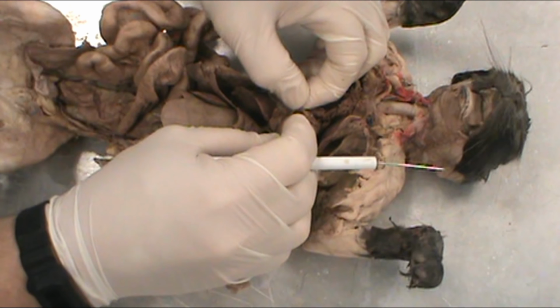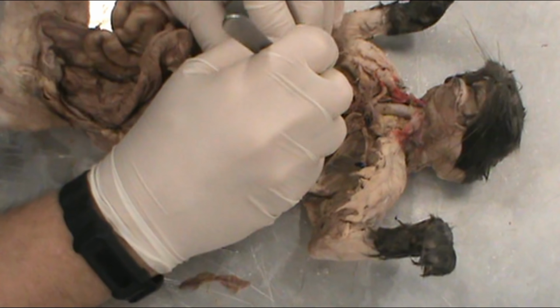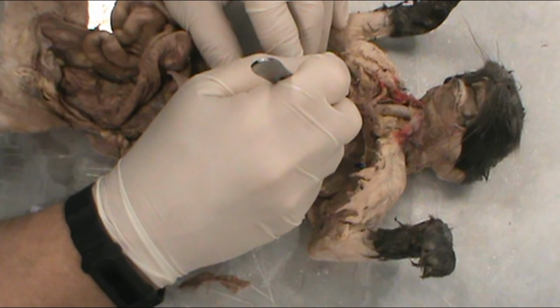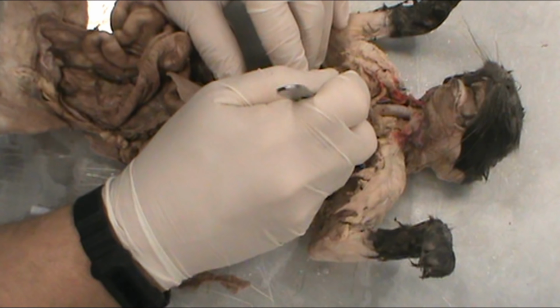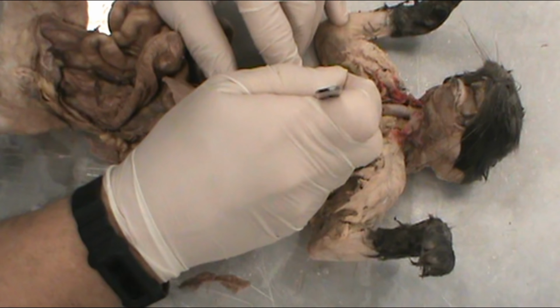And on this cat, we've removed the pericardium, which is this protective lining right here. Some of the cats still have the pericardium intact. This cat, we've removed the pericardium so we can get a better look at the heart. While we're up here, I'll take the scalpel and I will trim some of this tissue back so that we can see the nice pretty blue vena cava. All right, maybe the GoPro's got a good look at that one right there.